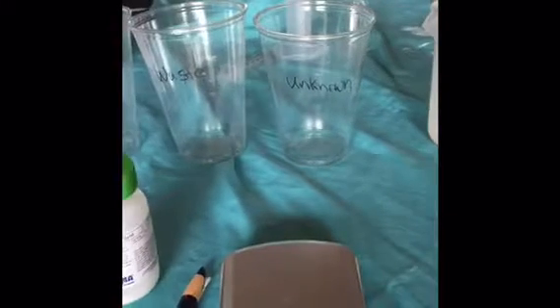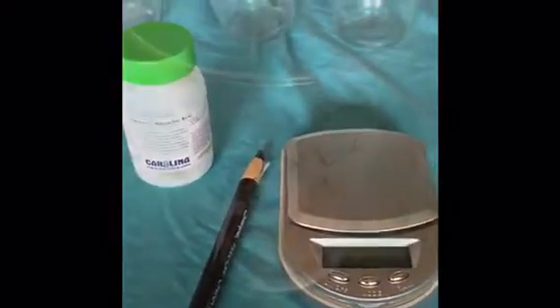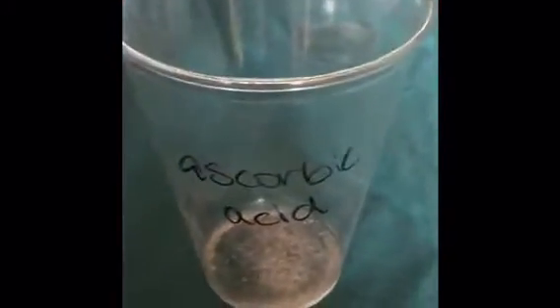Okay, so I am now beginning the 8th lab on determination of vitamin C by redox titration. I have gone ahead and labeled my 3 cups of ascorbic acid, waste, unknown. I have my 250 milliliter beaker filled with purified water, and I'm now going to weigh 0.5 grams of ascorbic acid. Okay, here I have my 0.5 grams of ascorbic acid, and I'm going to go ahead and add the 250 milliliters of water.